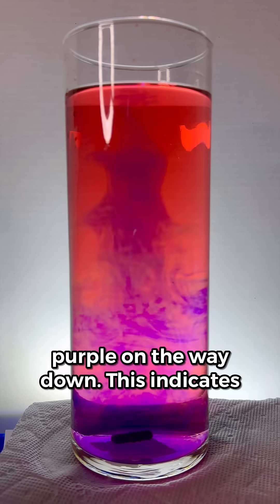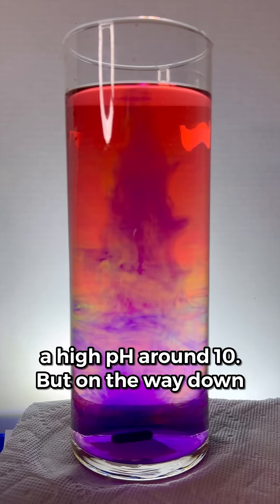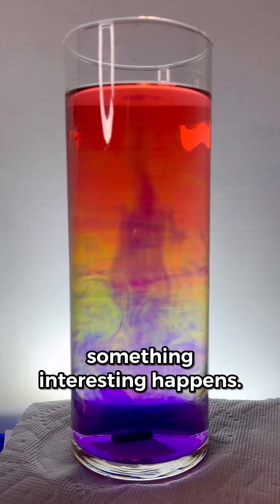Notice that it changes the color to purple on the way down. This indicates a high pH around 10. But on the way down, something interesting happens.